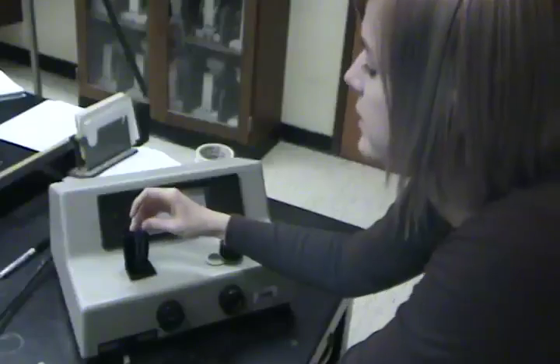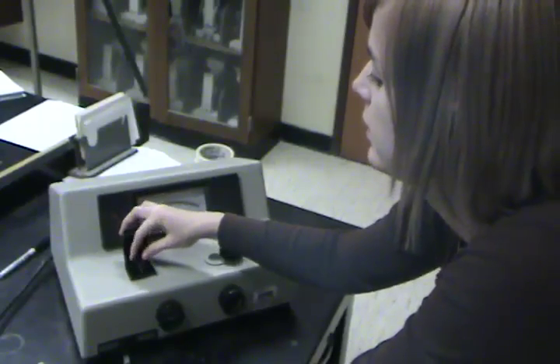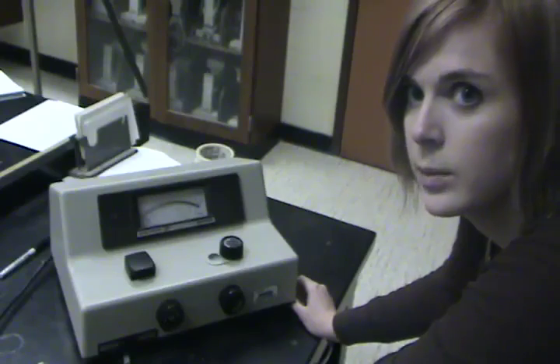These are our two experimental cuvettes. Place it in the spectrophotometer, remembering to line up the white line with the line on the spectrophotometer. The red line on the spectrophotometer will then move and you will be able to take your reading.